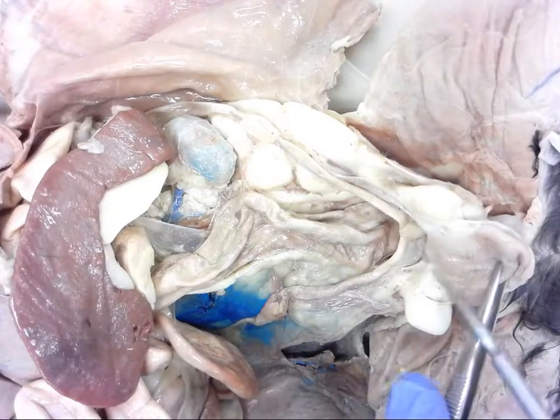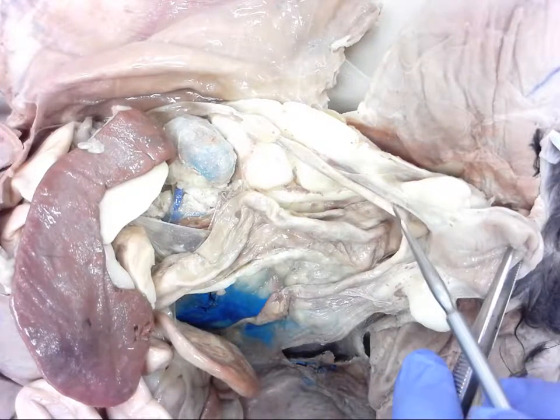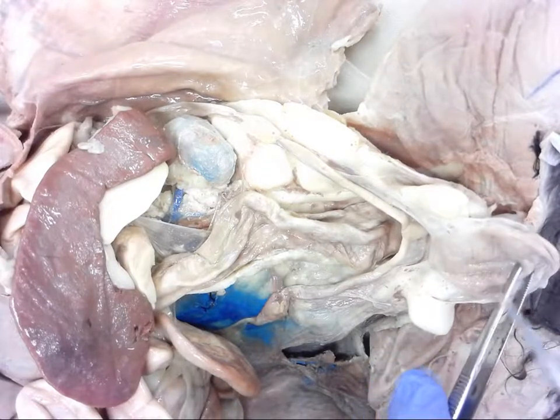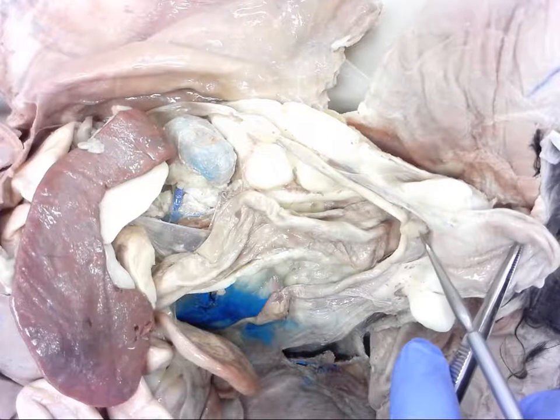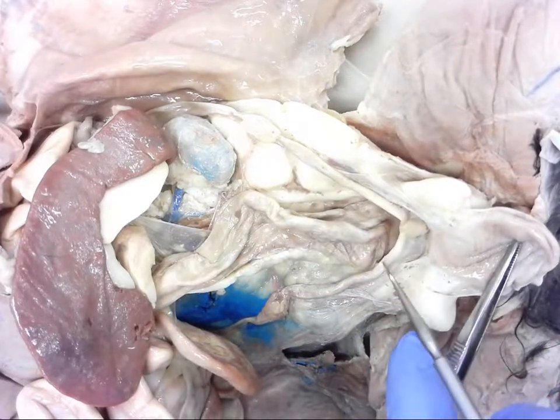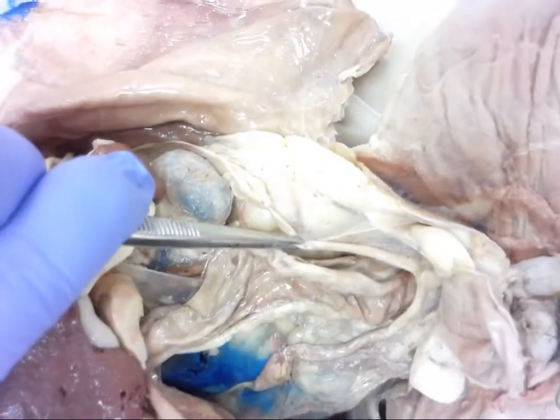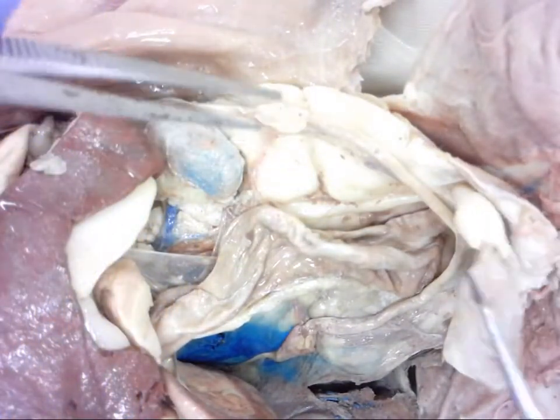I'm going to lift this up. In the human female reproductive system we have the uterus, and off of the uterus you have the fallopian tubes that go up to the ovaries. Now with felines, because we have multiple offspring we need a little bit more room, so the uterus is there but it is smaller comparatively to humans, and there are branches off of each side. These are pretty good examples - you can see these tubes that come off.